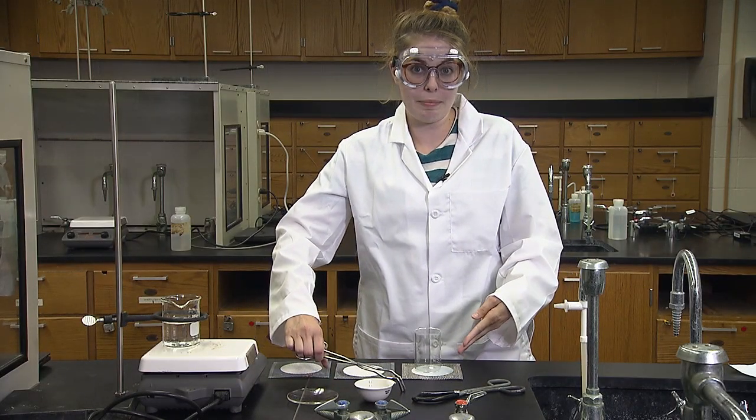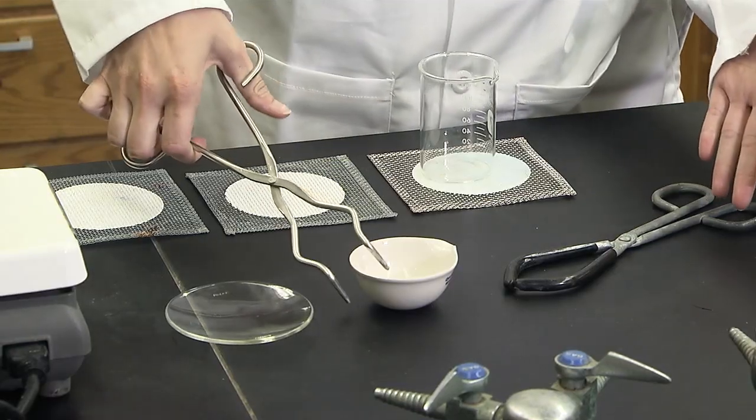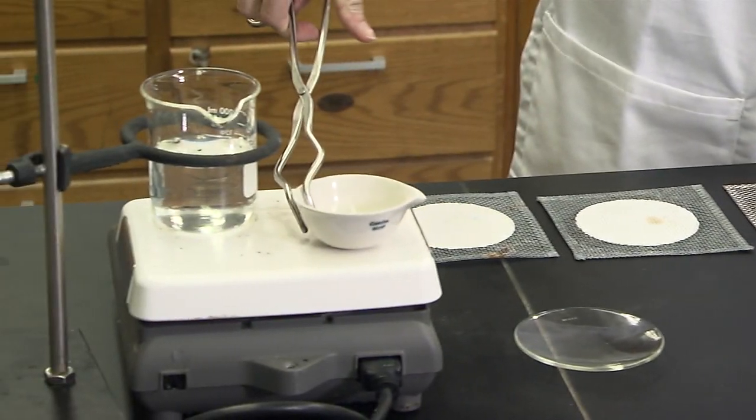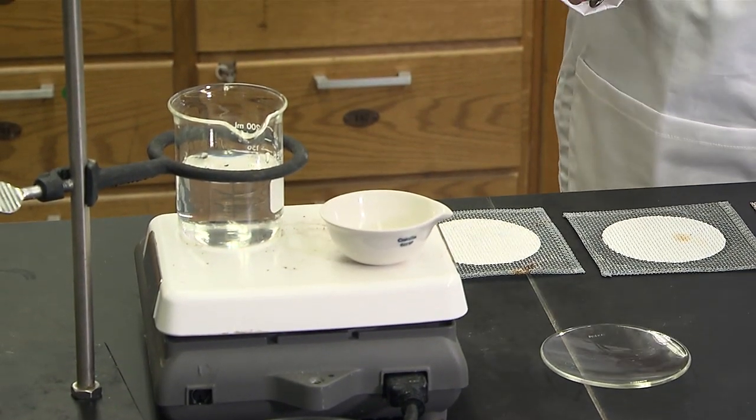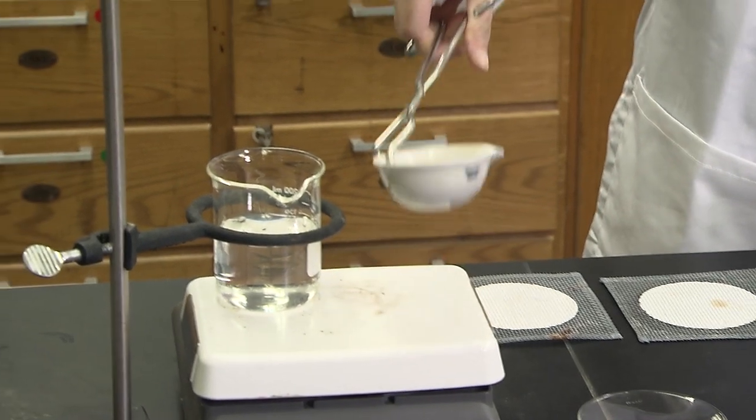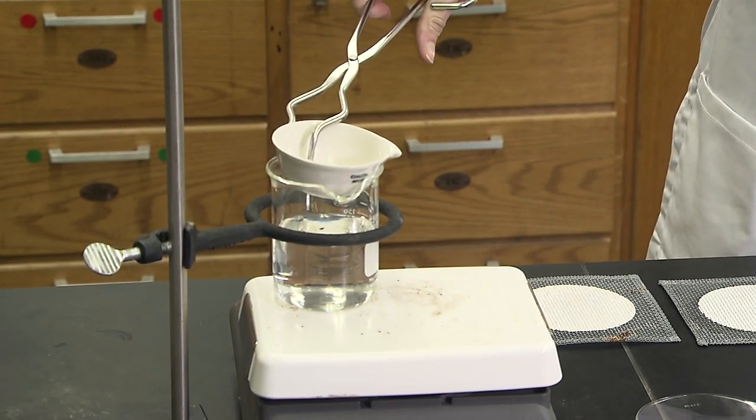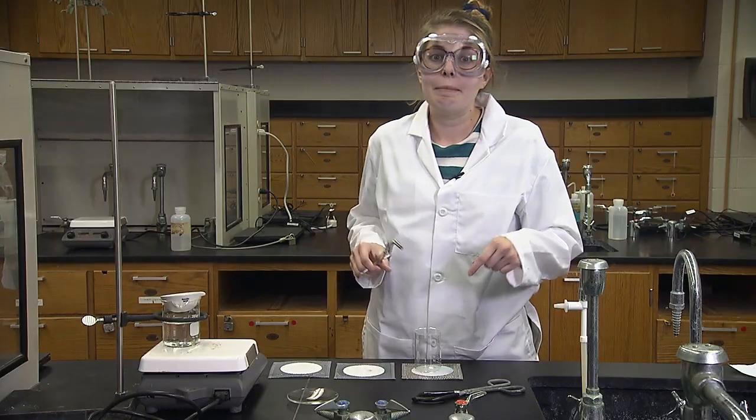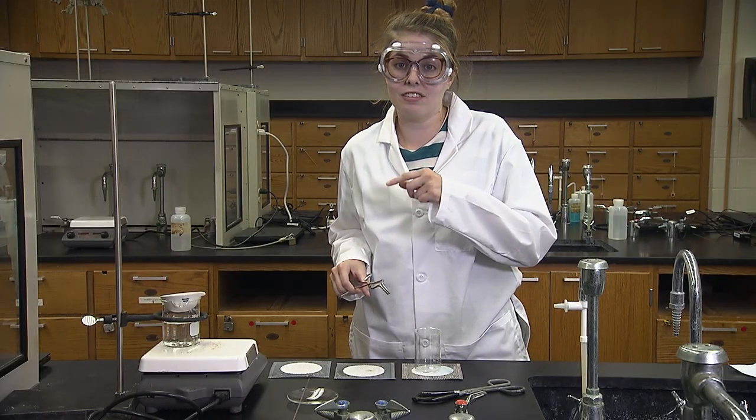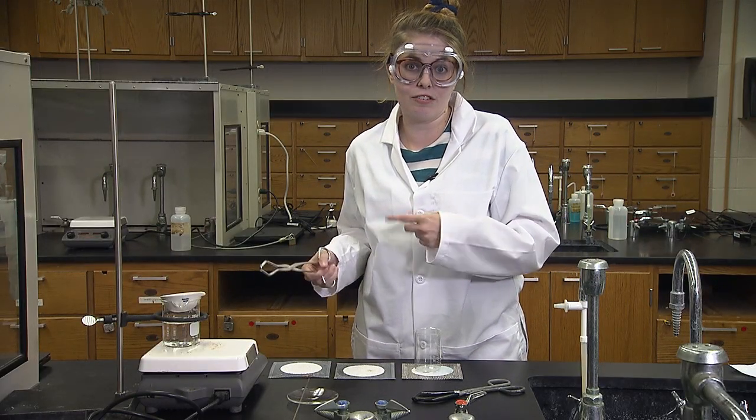The evaporating dish may be heated by itself or on the hot water bath. Make sure the beaker for the water bath is small enough so the evaporating dish doesn't fall into the water.